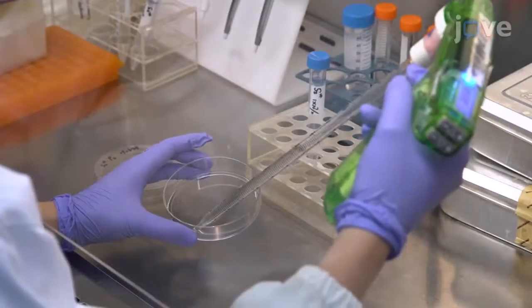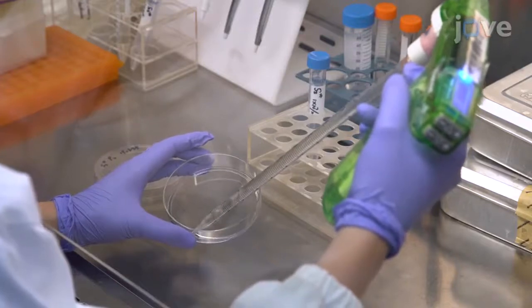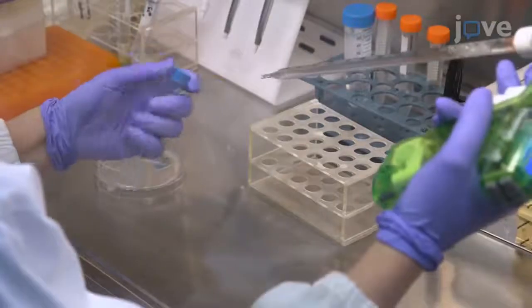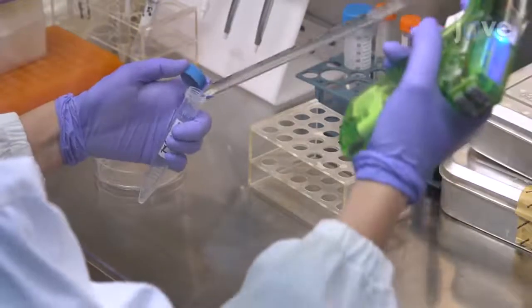Mix the supernatant by pipetting a few times before transferring the entire cell culture to a 15 mL tube for lysis of the host cells at minus 80°C.